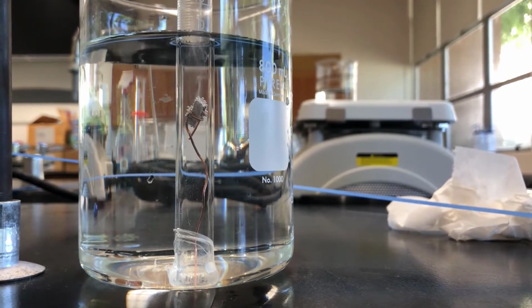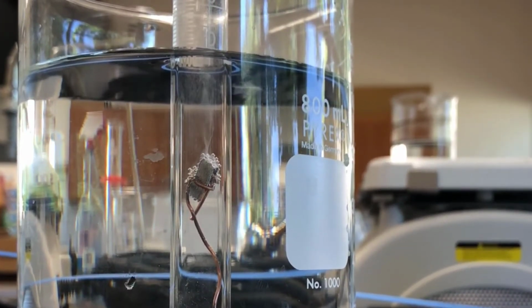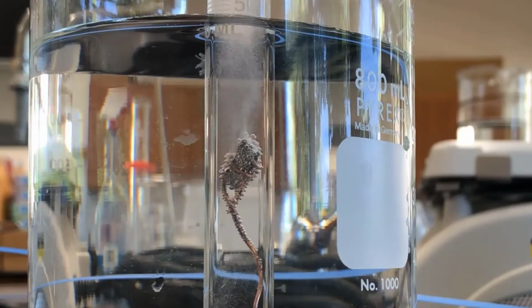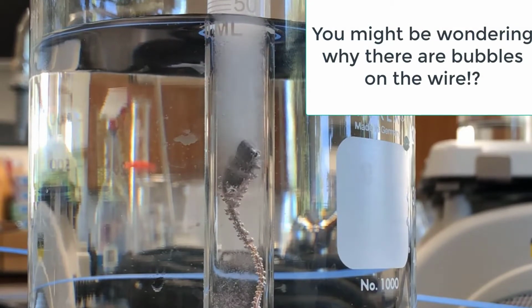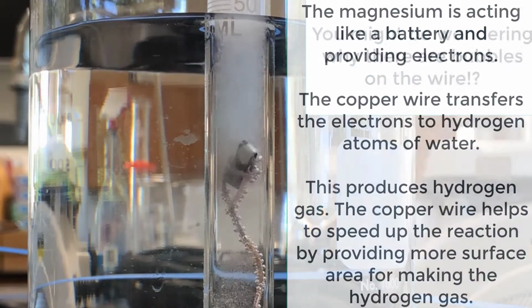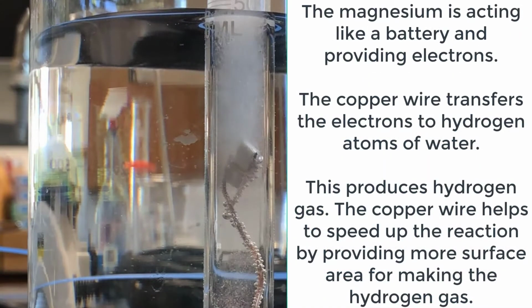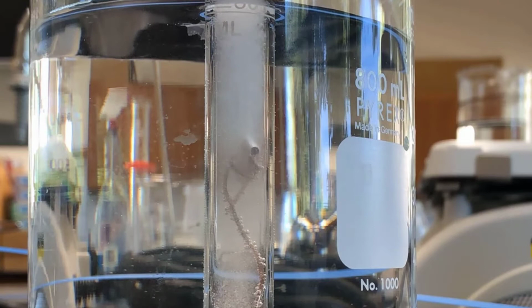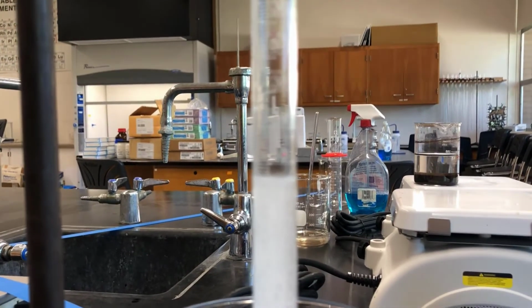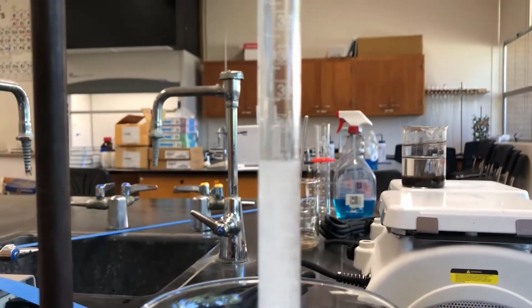Now, once the hydrochloric acid eventually drifts down to the bottom, it'll begin to react fairly rapidly, but it does take time. So I'm going to go ahead and put it on a time lapse. So we're getting close to the end. You can see, maybe you can see, gas is getting formed at a fairly rapid rate from the magnesium now.